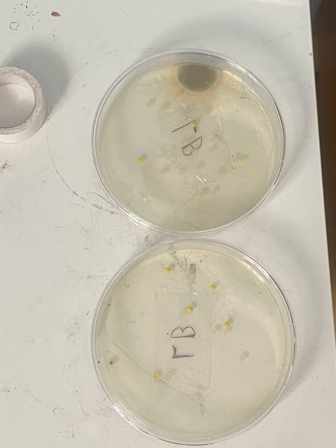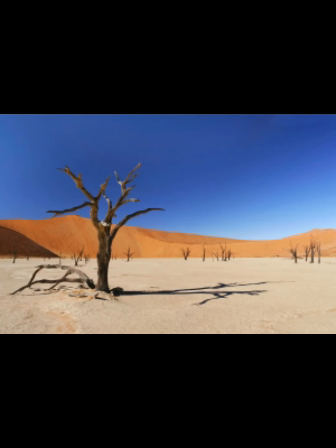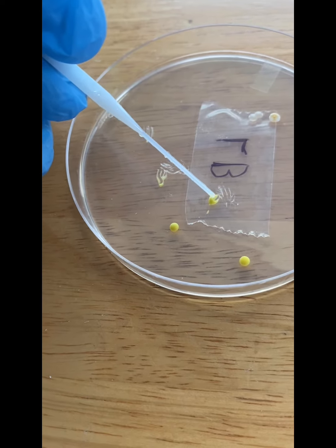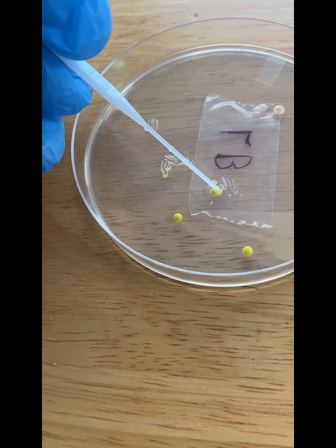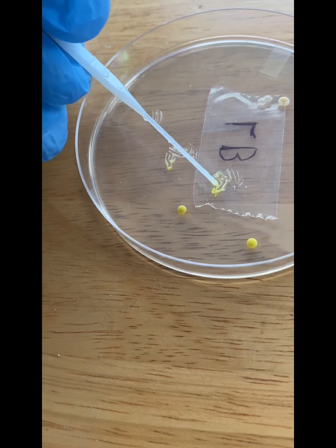coli around room temperature and having the petri dish in higher humidity conditions. To prevent this, simply grow your E. coli in low humidity conditions with higher temperatures around 30 to 37 degrees Celsius. Once you have fully formed colonies of bacteria, use a sterile inoculation loop to scoop them up and drop them into your bacterial transformation mix.